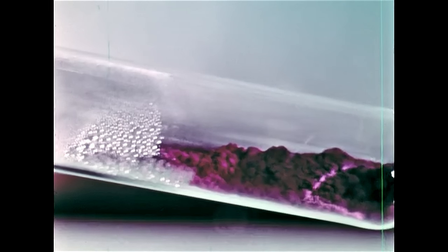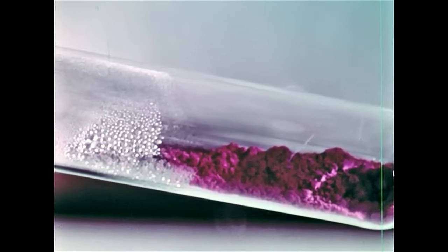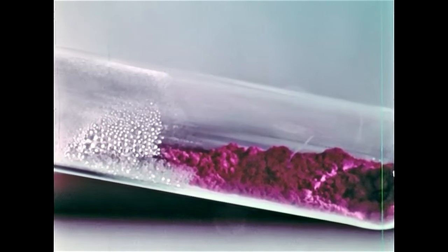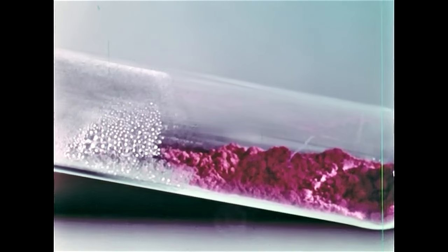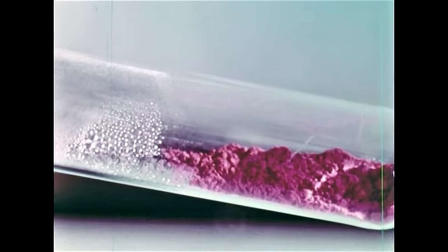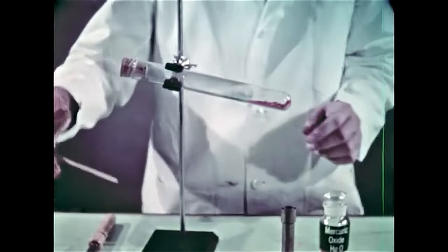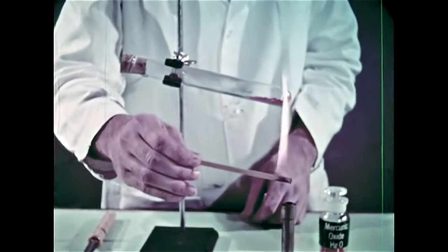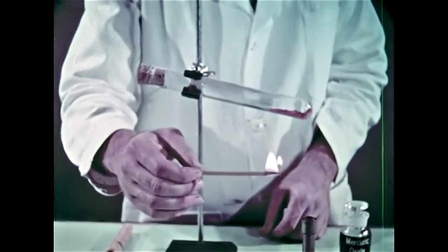We'll stop heating and allow the test tube to cool. The original darkening ascribed to change in crystal structure is reversible. You'll note that the mercuric oxide reverts to its original bright orange color as it cools. You've seen the mercury droplets form. Now we'll test for the oxygen. Of course, the combustion test converts the oxygen into water and carbon dioxide.